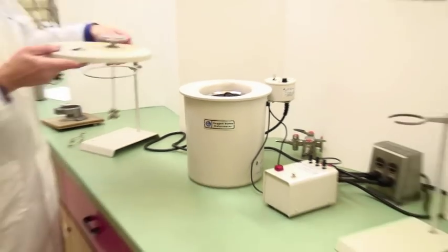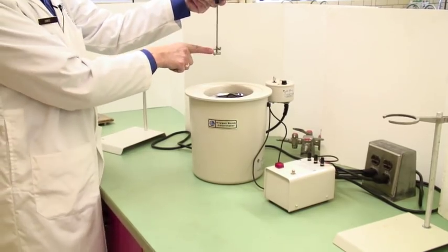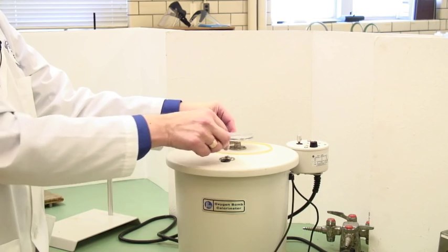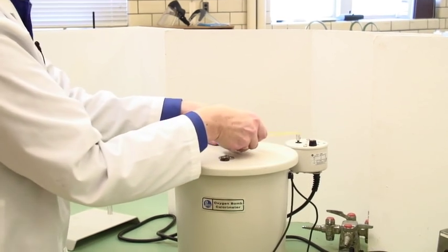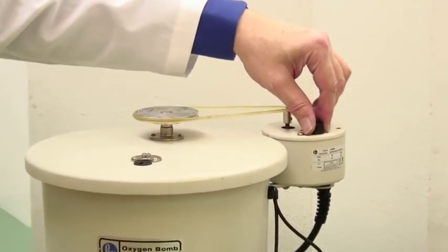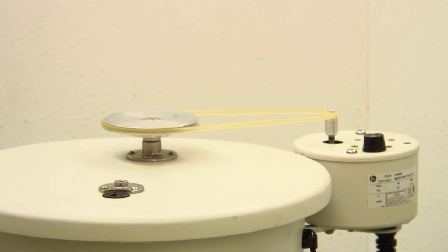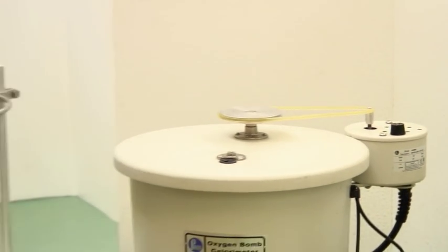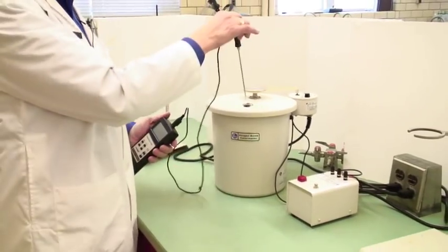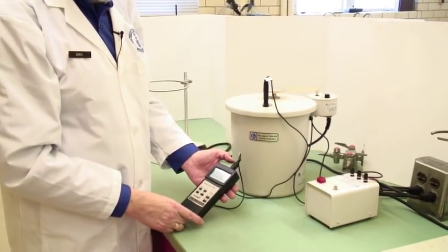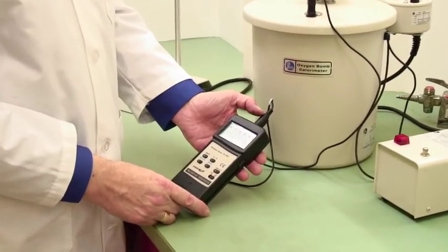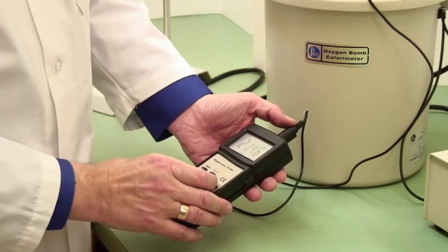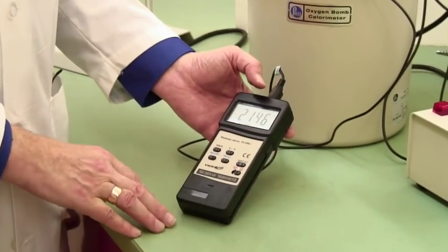The bomb lid has a holder there. Notice that the bomb was off center. The stirrer goes into the space provided. It fits quite snugly, and there is a stirrer. It fits with a drive shaft. This needs to be plugged in, and you turn that. We've now got a stirrer making sure that we've got uniform temperature within the bucket. There are several thermometers available. It's the thermocouple probe and it just slides down in there like that. Turn the thermometer on. Make sure that you're getting a decent temperature here. You want two decimal places of degree. So this one is reading 21.46 at the moment.